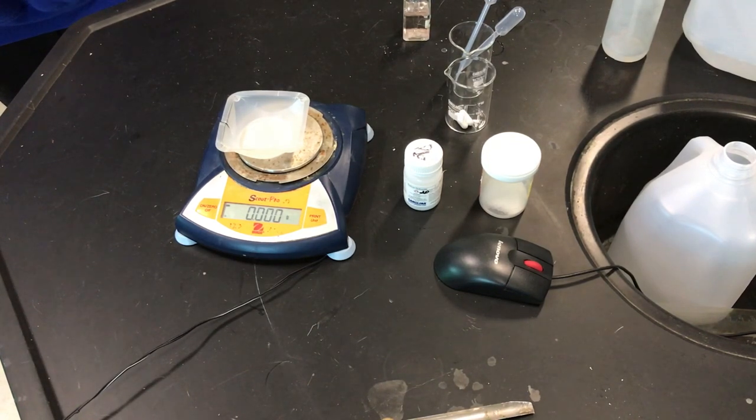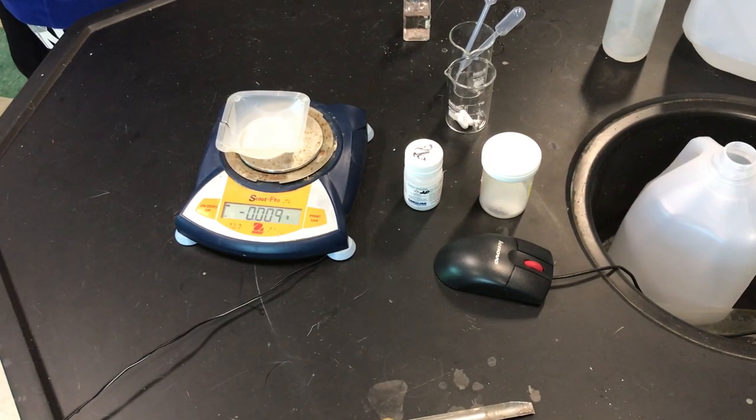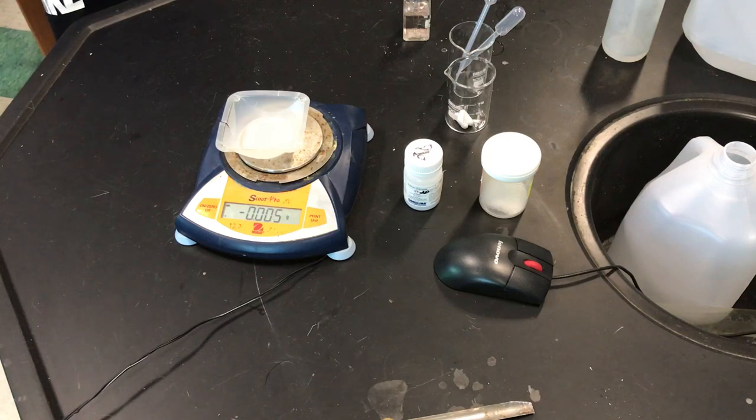How many tablets are we going to crush in this lab today? Two. So both have two, good. When you did two and you did the stoichiometry correctly, you should have come out with 0.00722 moles of hydroxide. That's going to be your target amount. Taking 650 milligrams of aspirin, using the molecular mass of 180 and knowing two hydroxides are necessary for one aspirin, we get 0.00722.